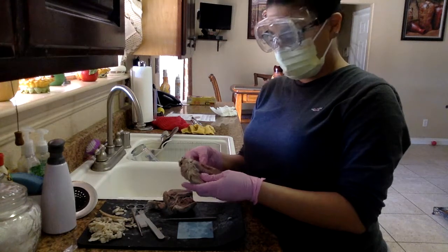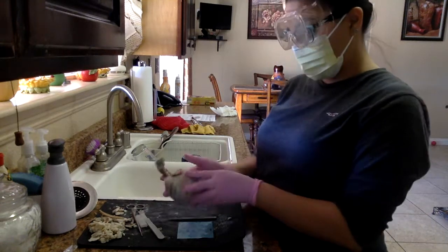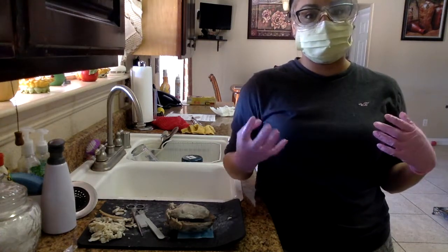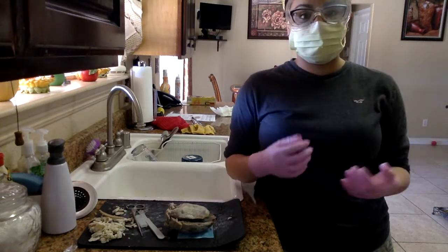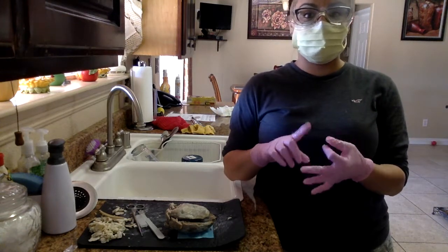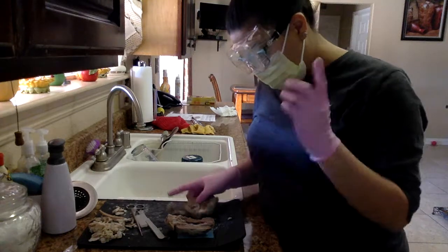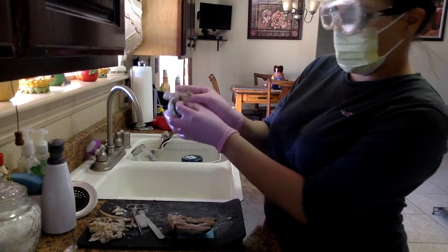It was very difficult to figure all of this out. I'll be honest. The cardiovascular system is very complex, and it was always one that I was scared to learn about because there's just so many things to memorize, and everything that we can name: the tricuspid valve, the right atrium, the auricle of the right atrium, the aorta, the aortic semilunar valve, all of these things, which I forgot to mention the aortic semilunar valve. So, sorry, that is this portion here, okay?